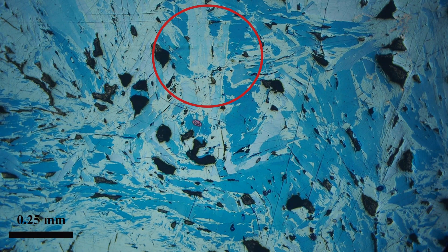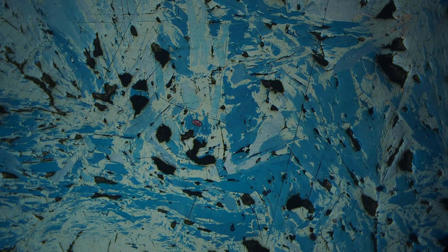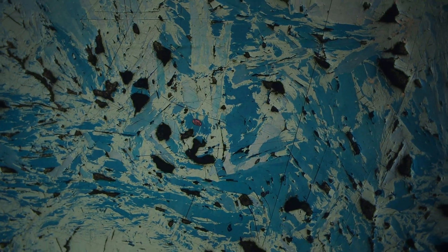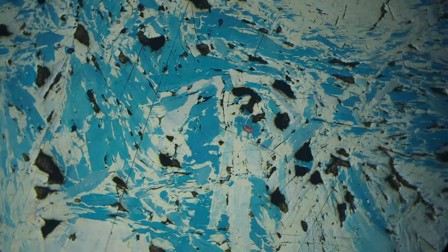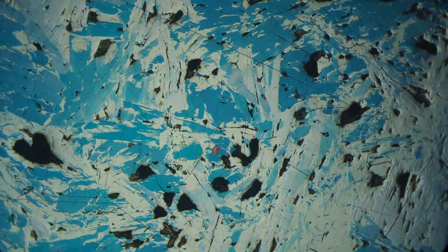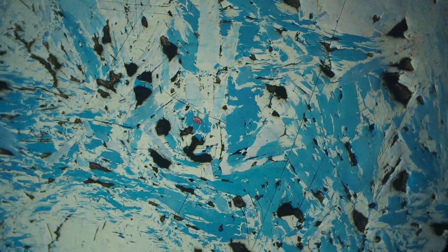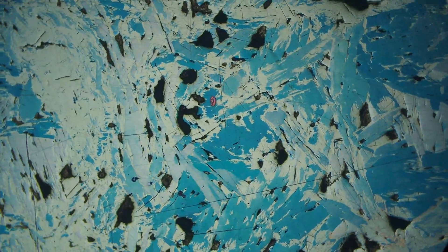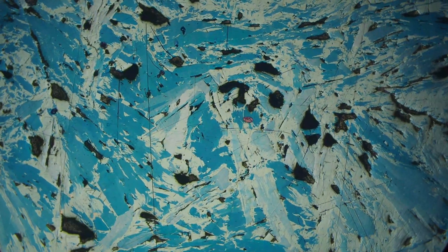Hi everyone, today I'm going to explain how to identify covellite in polished section. Here we have covellite and you can see there are some bright blue colors. As we rotate the stage they go from blue to kind of light blue — this is bireflectance. Covellite has strong blue-violet to bluish-white bireflectance, and you can still see the colors wink out and back in as the stage is rotated.